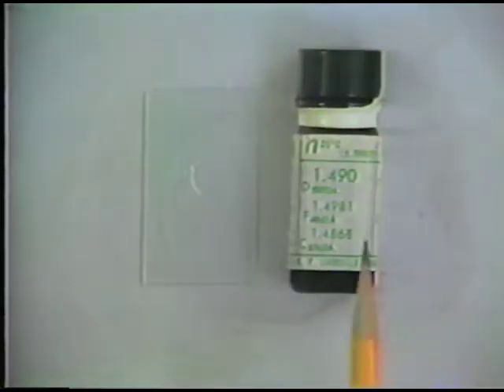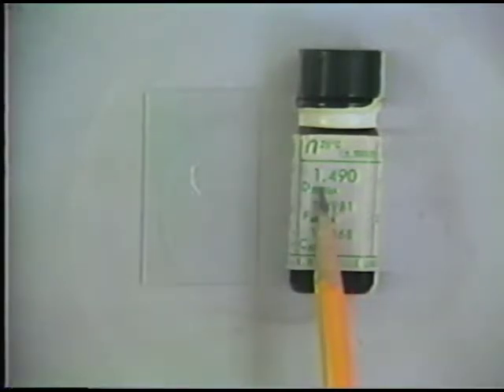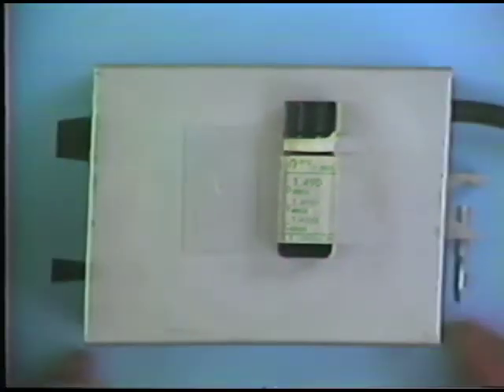One reason we need to check the refractive index of oil is because it's strongly temperature dependent, so that any particular refractive index that you see on a bottle is subject to room temperature variations, and the refractive index of these liquids is quite sensitive to these kinds of changes. They're also sensitive to evaporation that can happen if the bottle is not tightly sealed, so they do need to be measured.